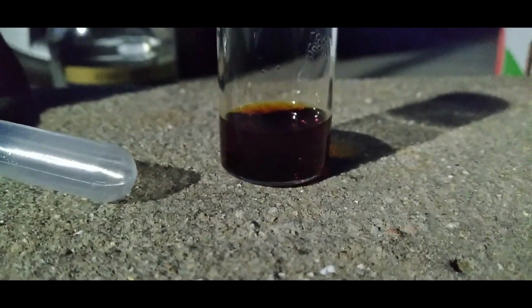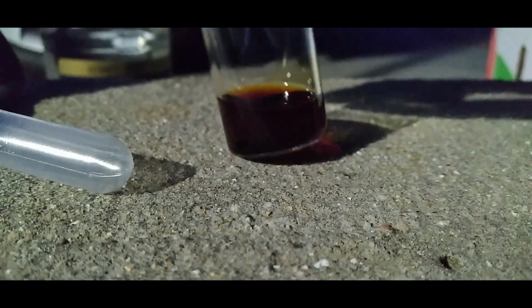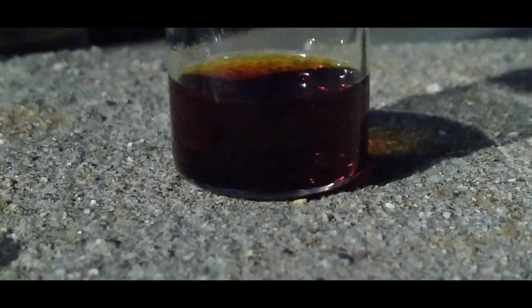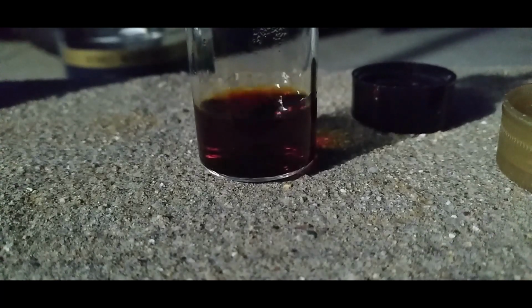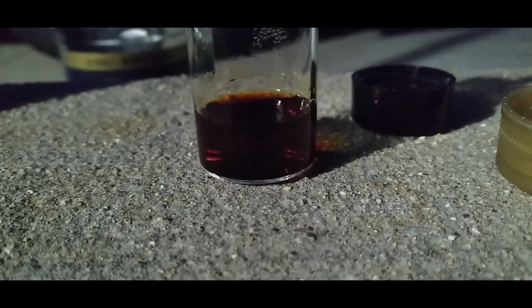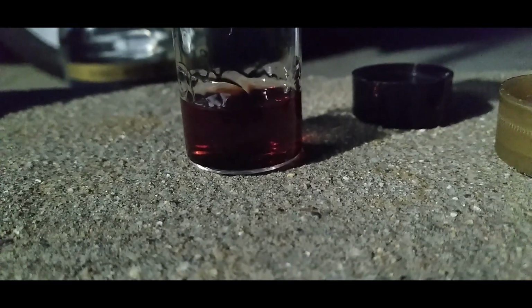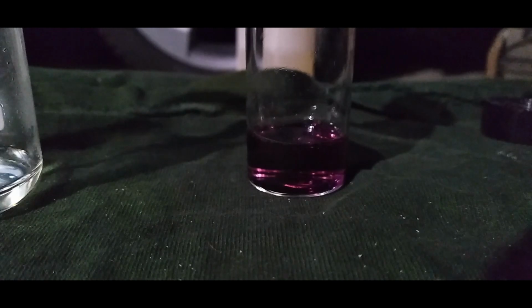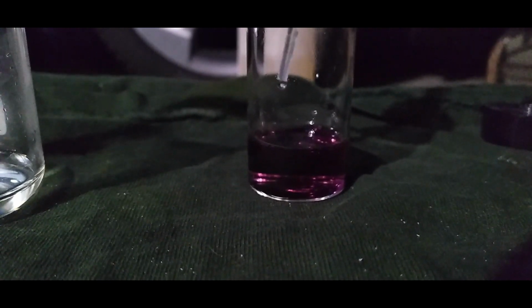This time around, I invested more osmium than usual. This dark, concentrated solution of sodium osmate contains about 40 milligrams of osmium. Before I can attempt to reduce this solution, I add ethanol to stabilize the sodium osmate. This changed the solution from a dark red to a dark purple. Once fully stabilized, I added hydrochloric acid in hopes that it would precipitate osmium dioxide.